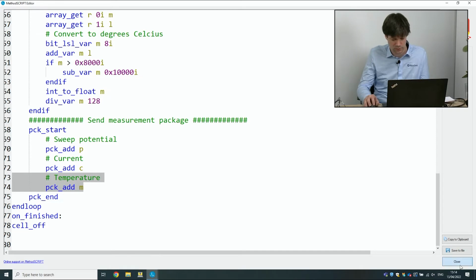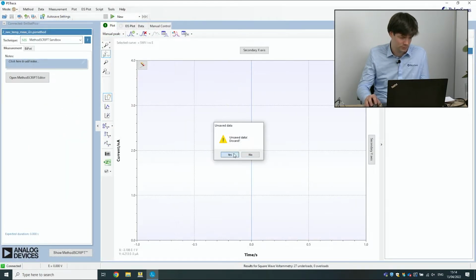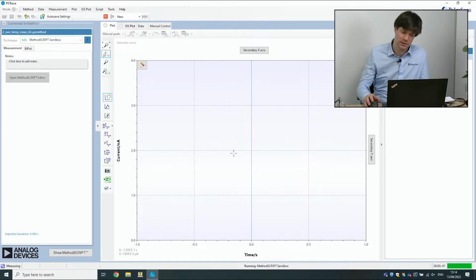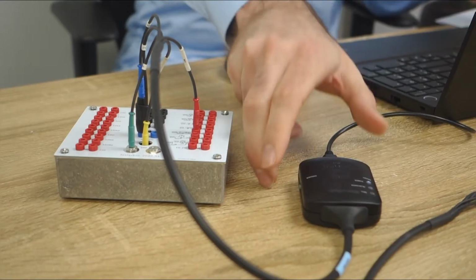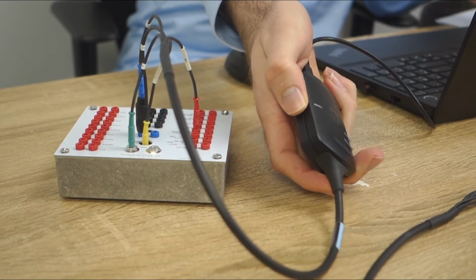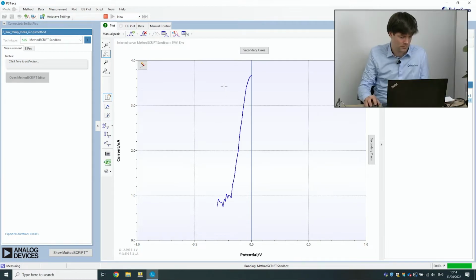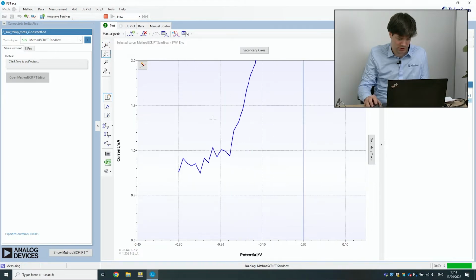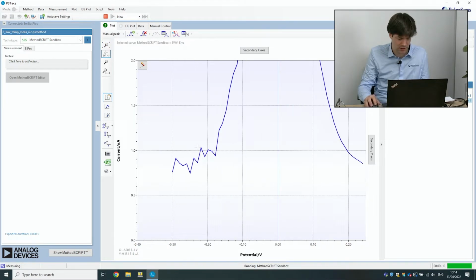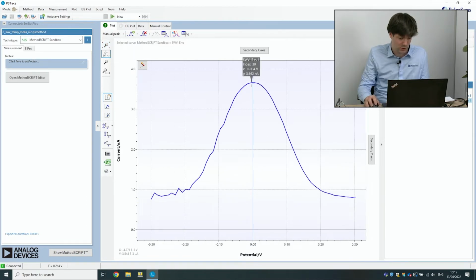All right, so we're going to run the script now. This should give us the same peak, except it's not going to start right away because we said we have to push a button first. You can see the button here. So we push this button, and now you can see the cell coming on and the measurement is starting. We've added a little bit of noise just because I was touching the device in the measurement, and it's quite a sensitive measurement. But otherwise, we have the same kind of peak here.